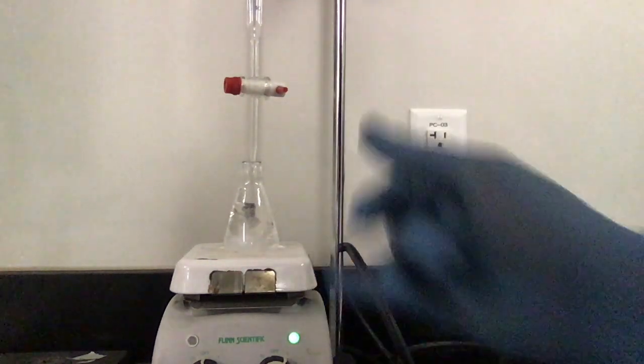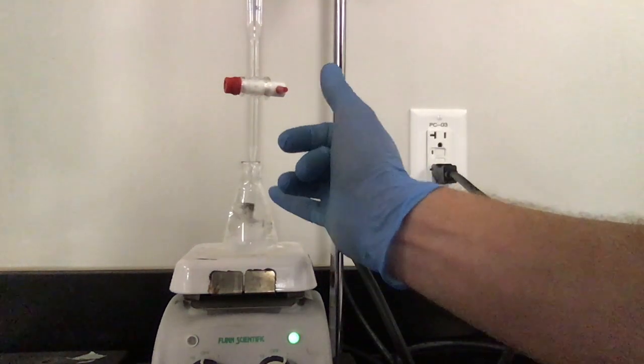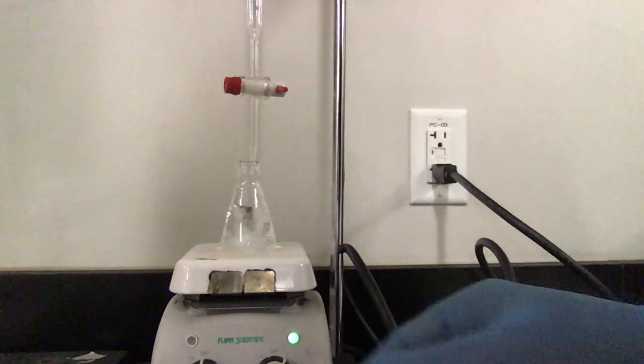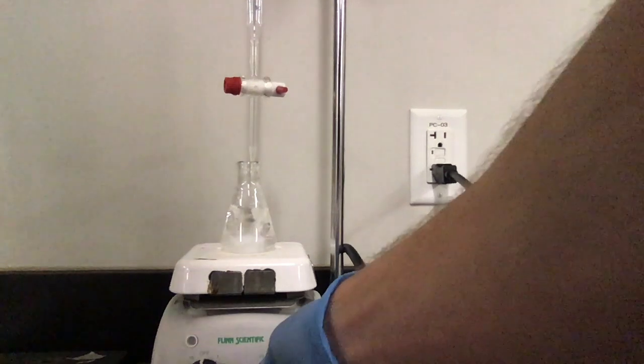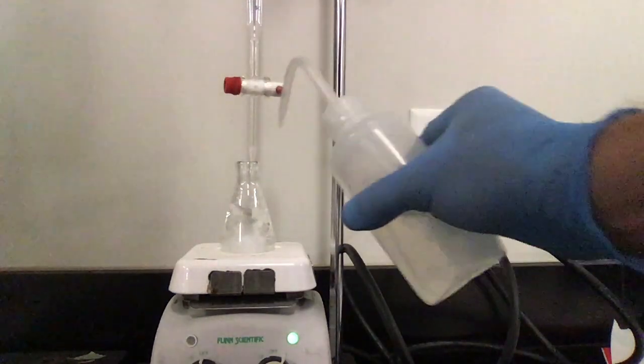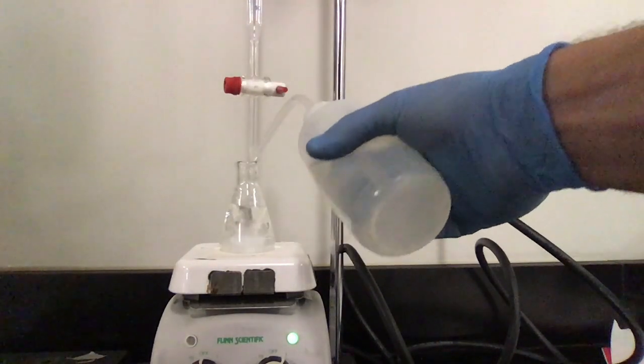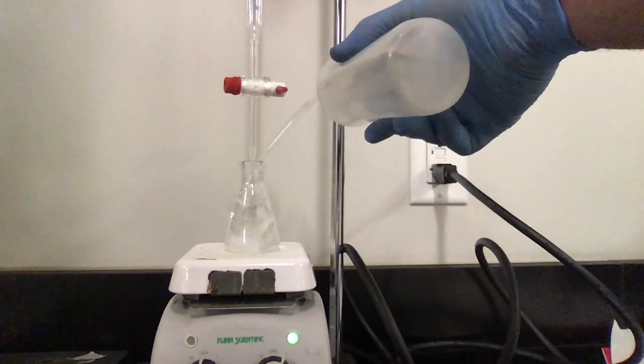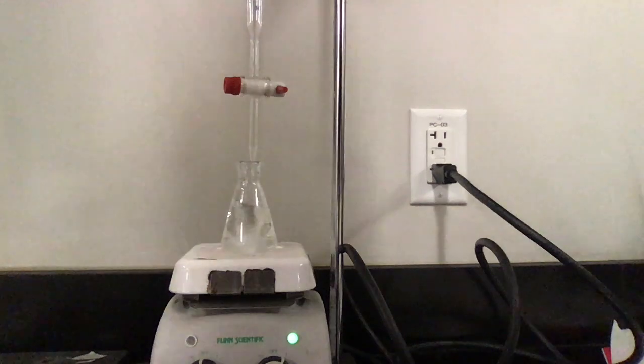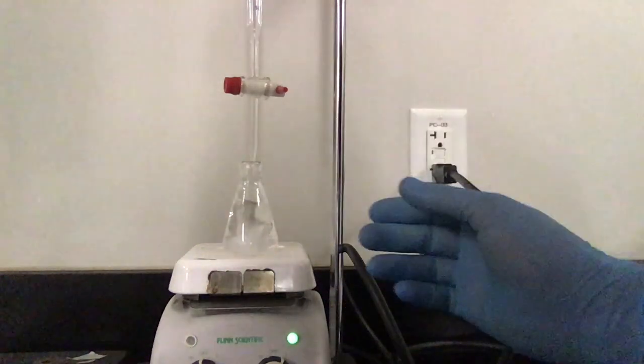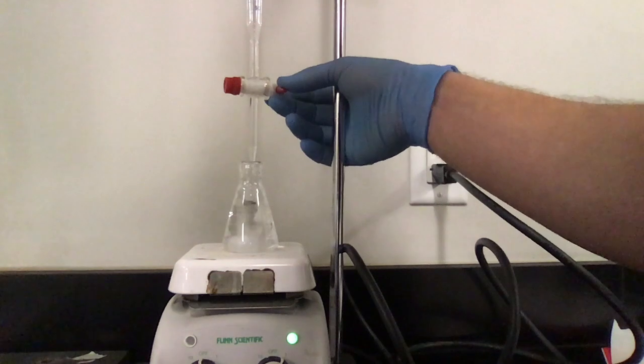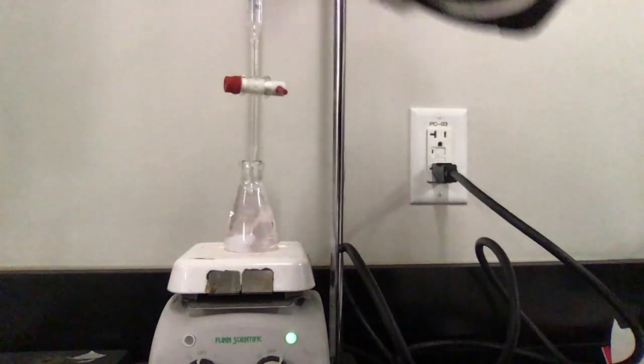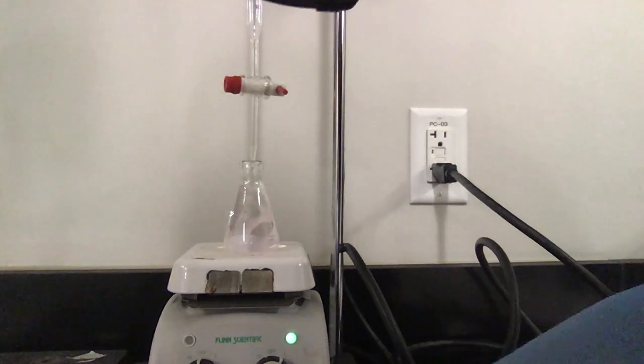I'm actually going to stop because you guys can see that I have splashed a bunch of liquid up and around this edge. It's going to give me some wonky data. So what I'm going to do is I'm going to take my water and I'm just going to rinse that stuff down into my solution just to make sure that all of my solution is where I want it to be. Okay. I'm going to speed this up for you guys. Okay. I think that's pink time for a trial three.